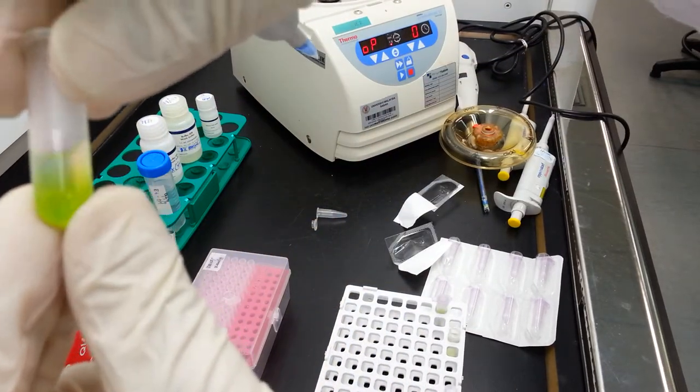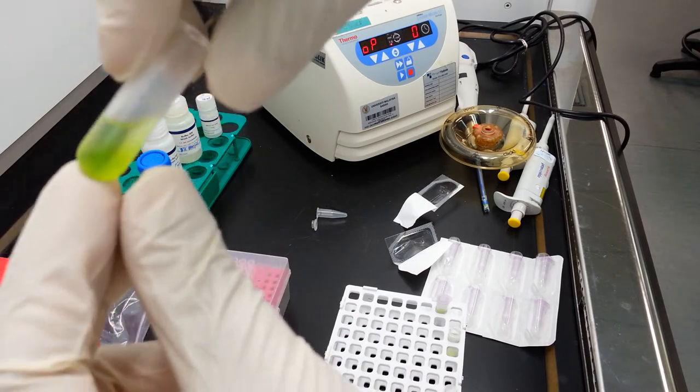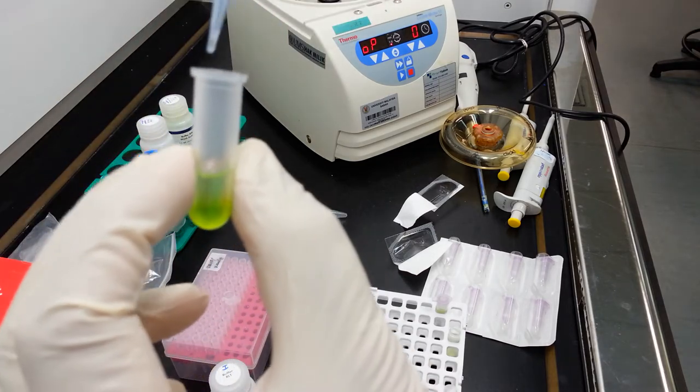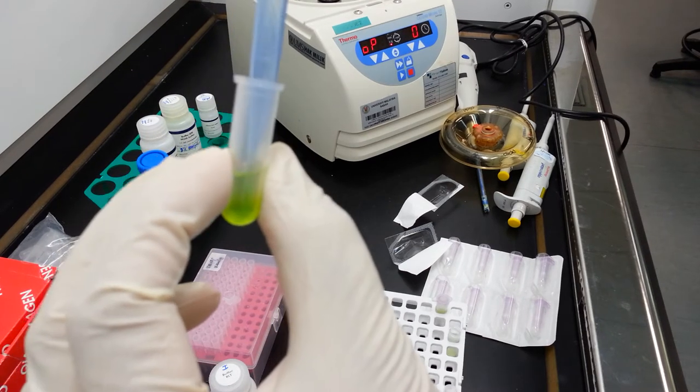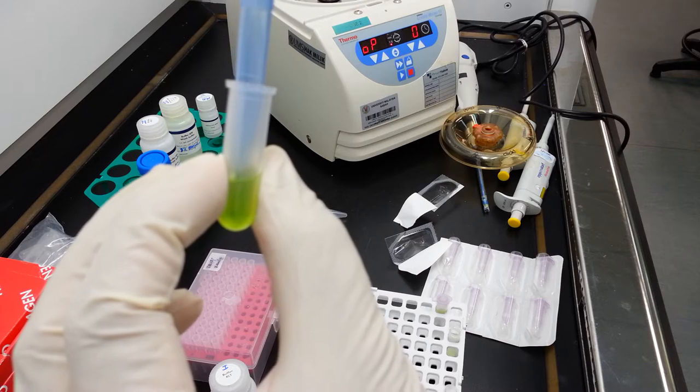This is what you will see. You may see some formation of precipitate, but all of this needs to be transferred into the next column. So briefly pipette this mixture.